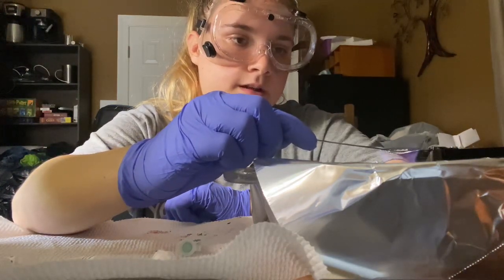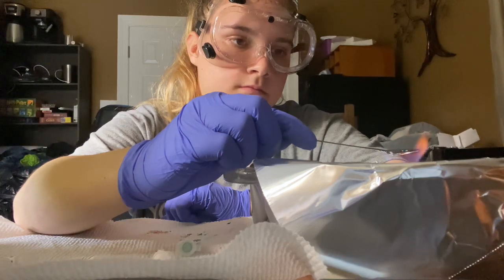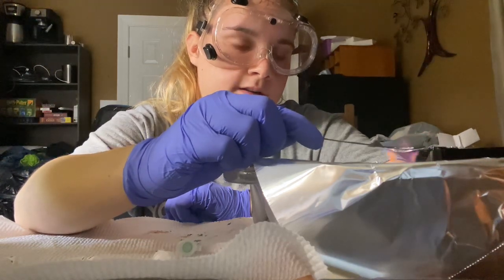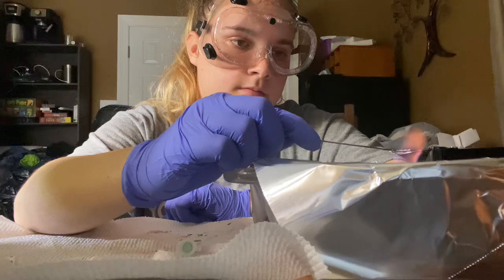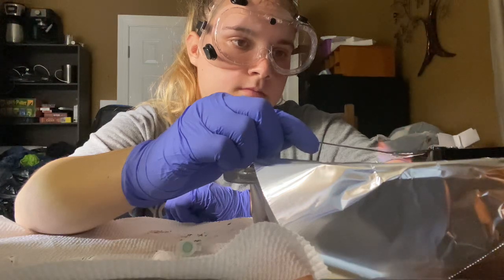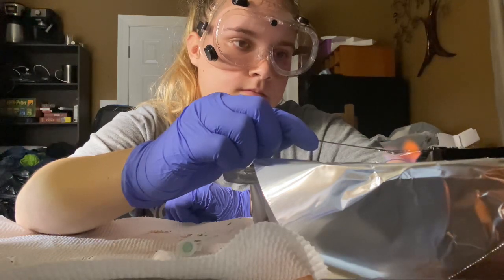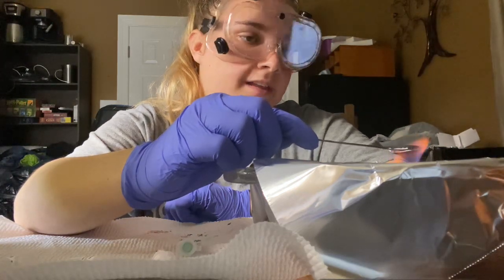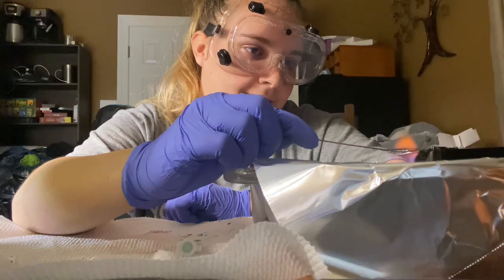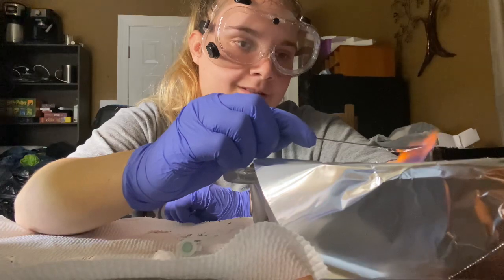And it's giving off no color change. And it's not melting either. Do you think that's a color change? There is no color change occurring. Yeah, bright orange, but whatever. It's probably just the regular fire.